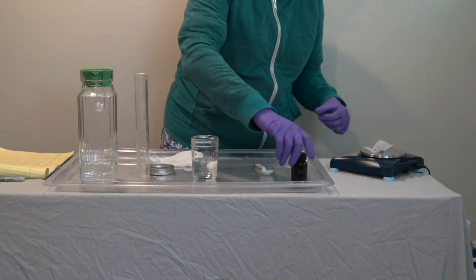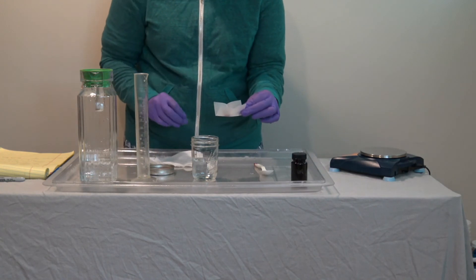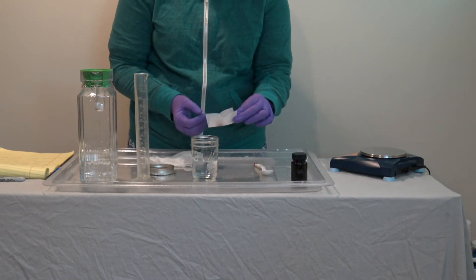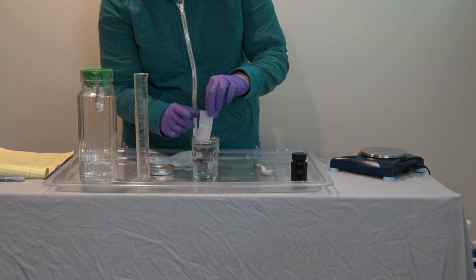And now you can add the powder to your water. And you're going to notice that it smells kind of sulfury and kind of like cabbage, which would be no surprise.